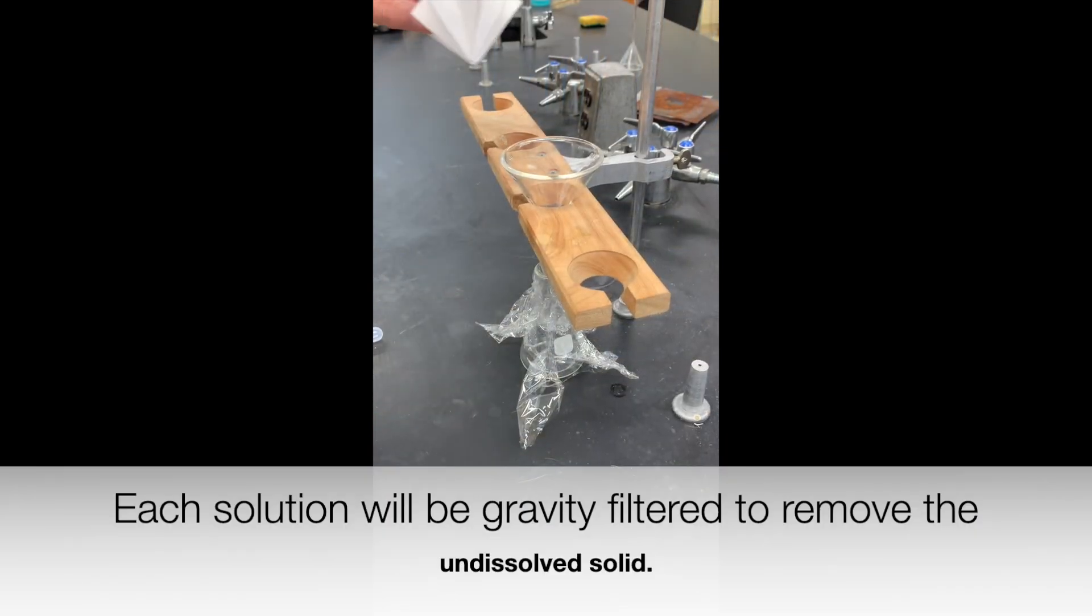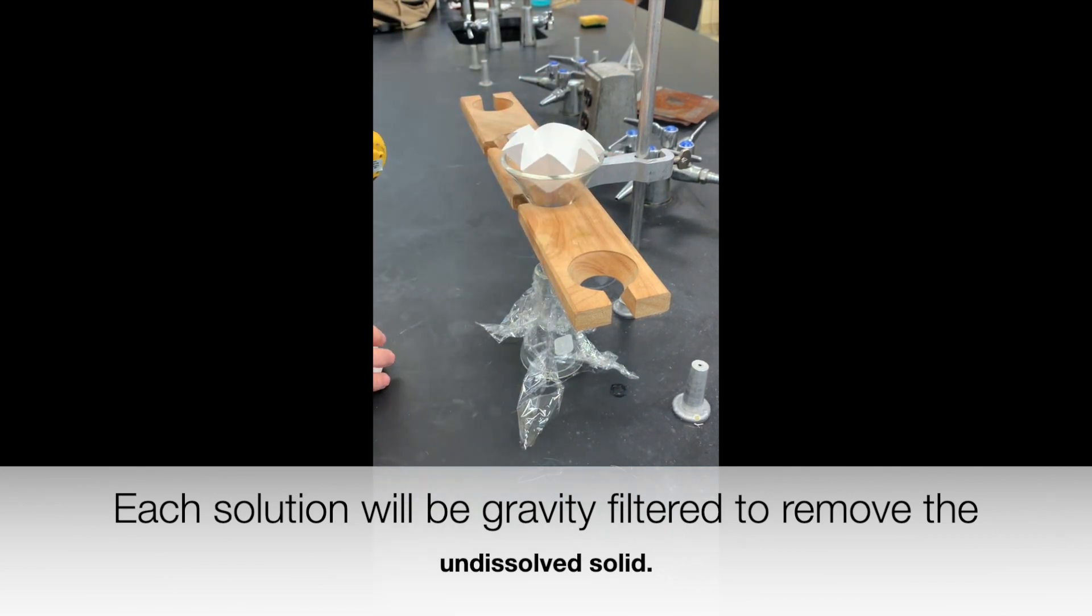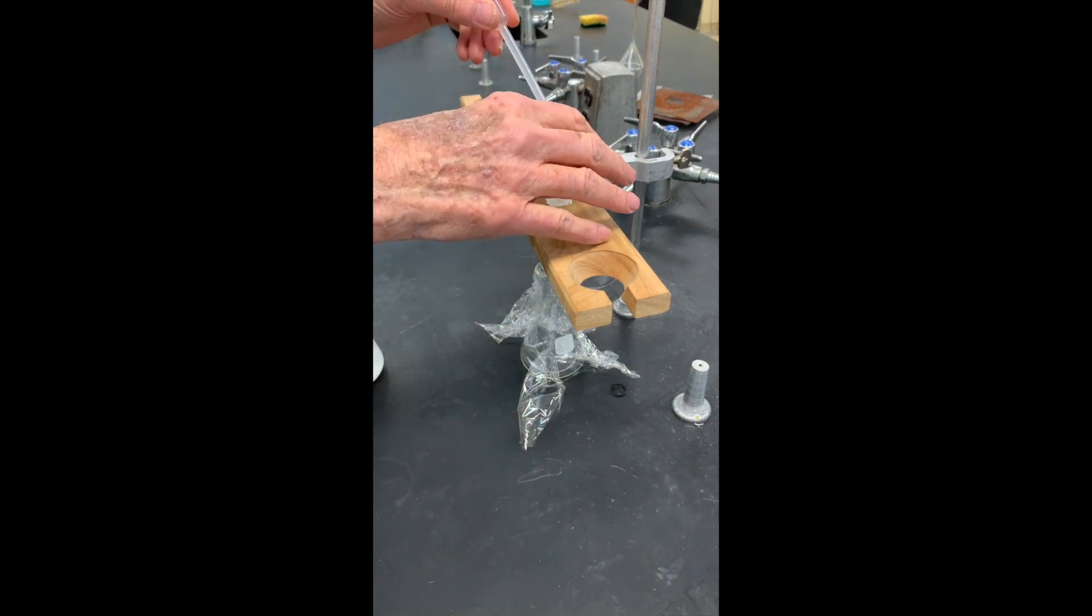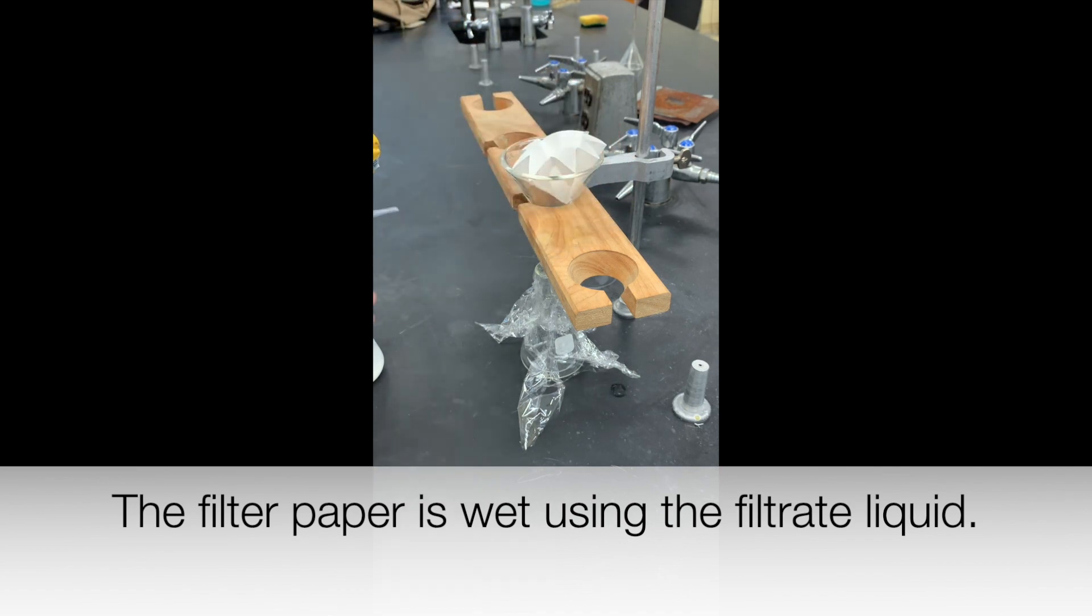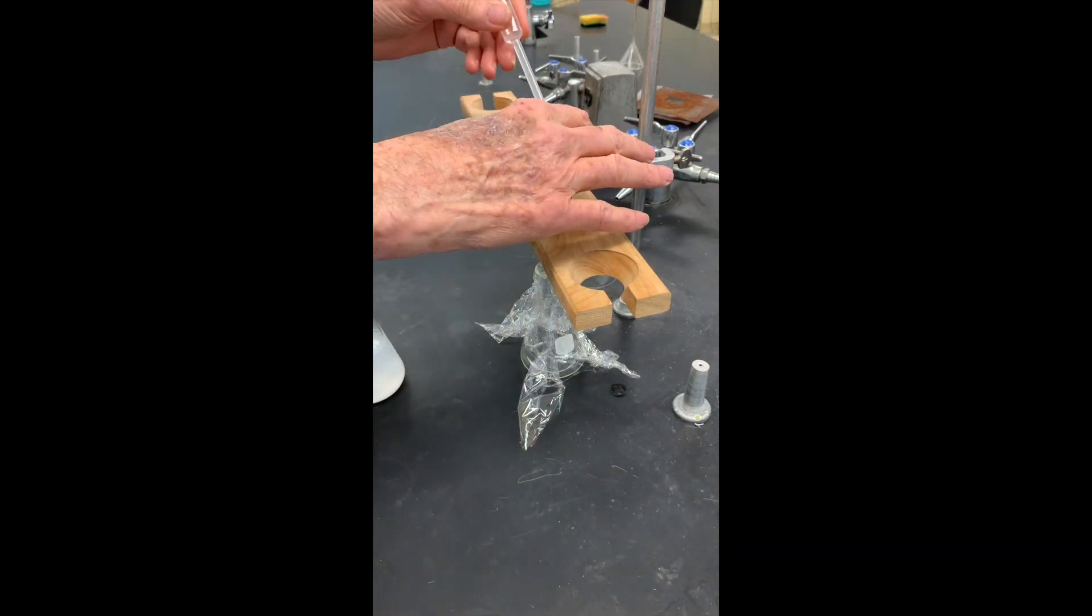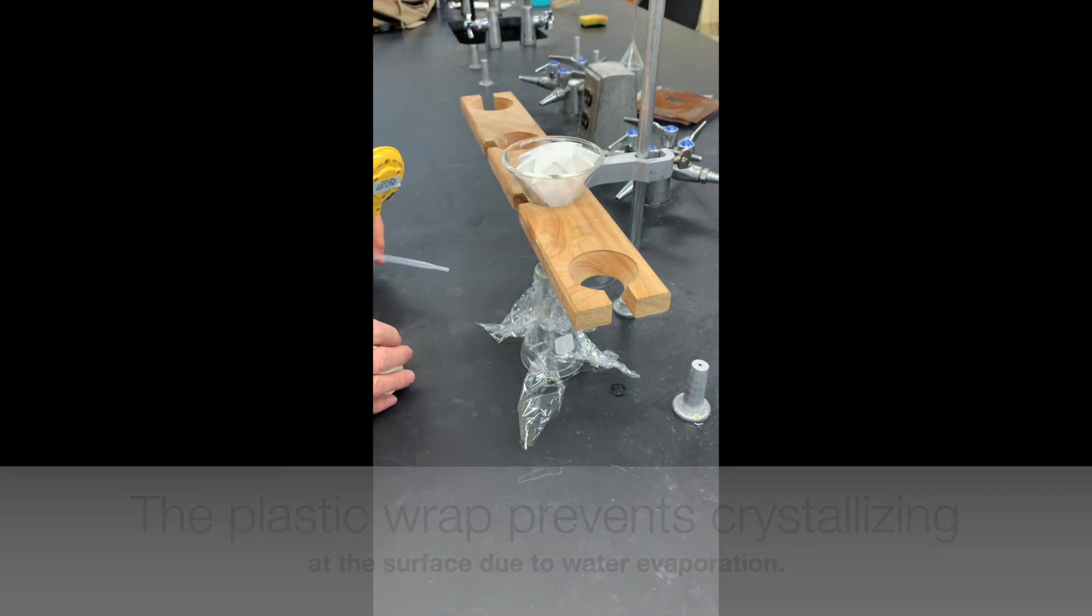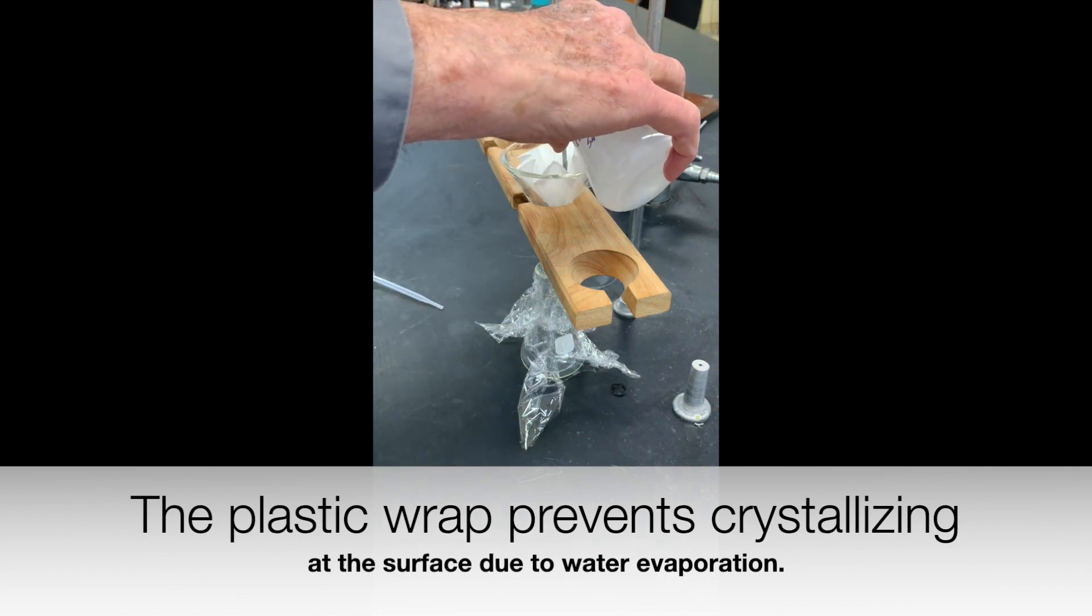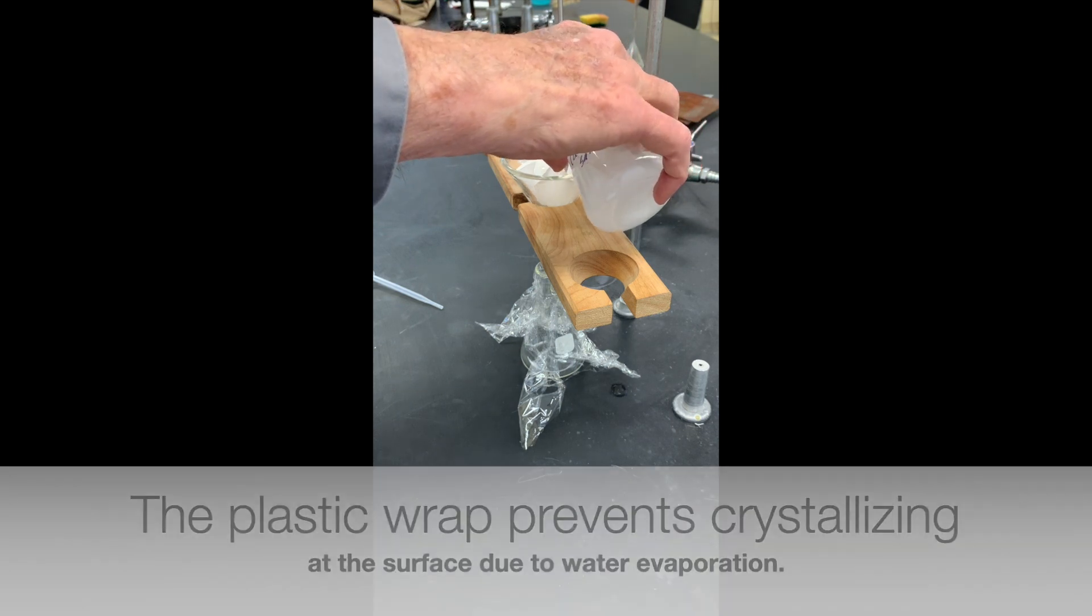Each solution will be gravity filtered to remove the undissolved solid. The paper is wet with the solution. The plastic wrap prevents crystallization at the surface due to evaporation.